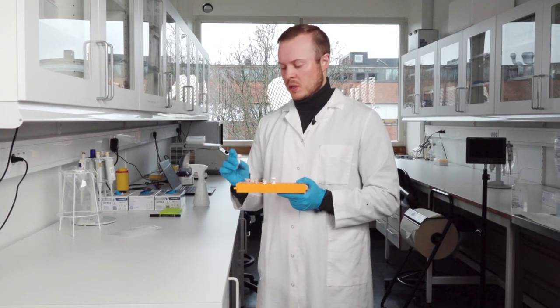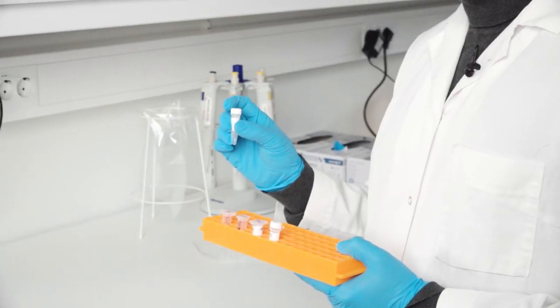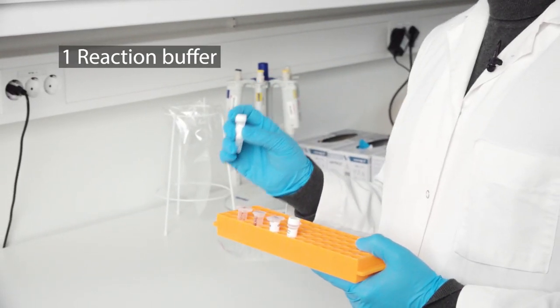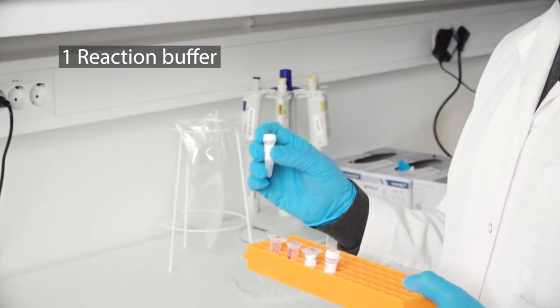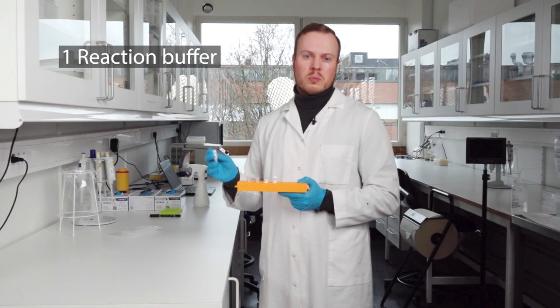The first part of the master mix is the reaction buffer. It's the buffer that ensures that the reaction can happen, that it has the right levels of salts, pH, and so on.